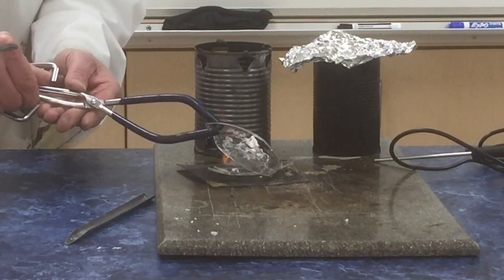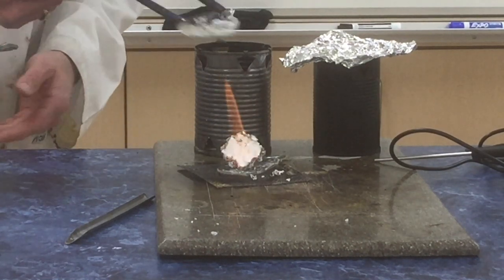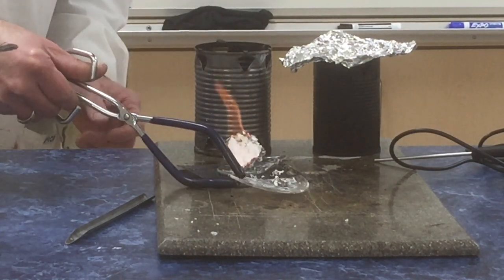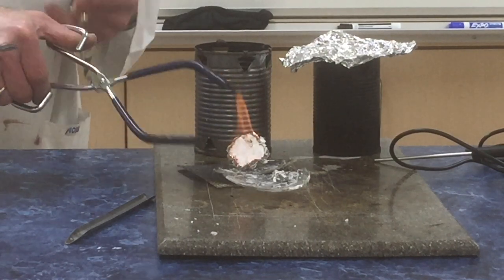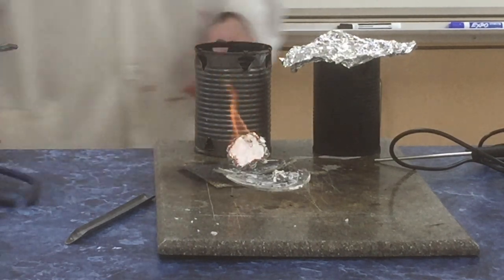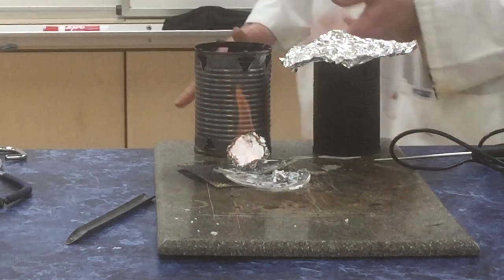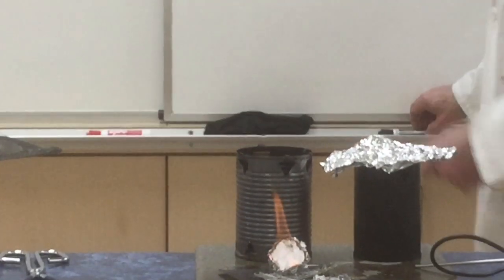We've got two pieces here. So an enormous amount of enthalpy was generated from the combustion of 40 grams of ethanol.